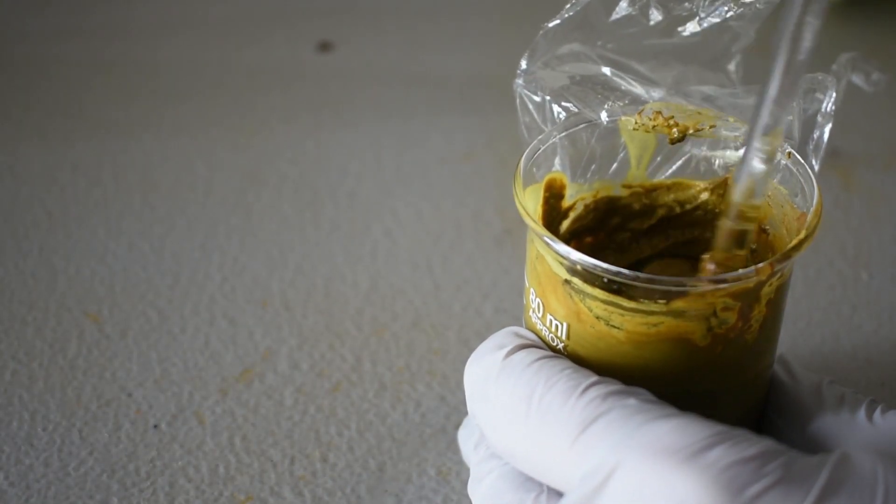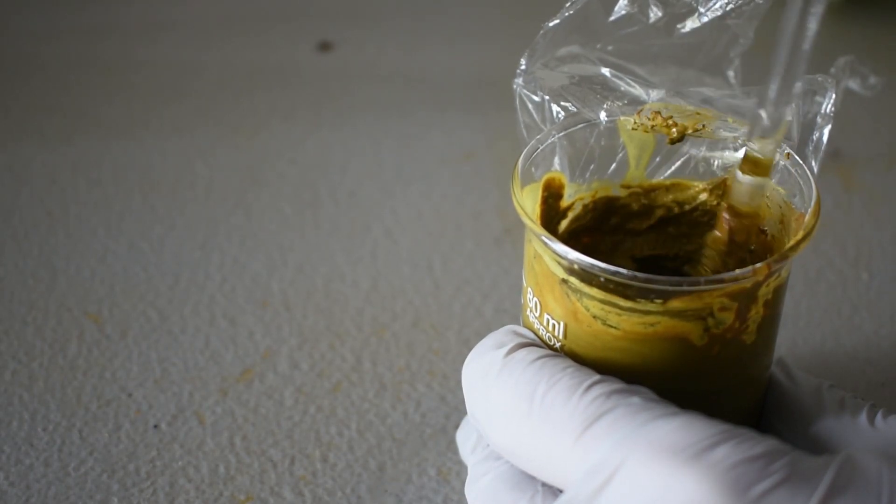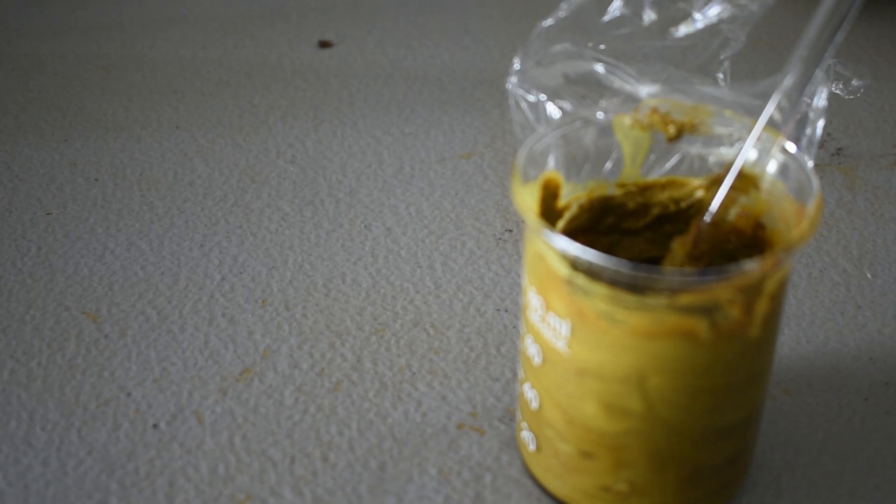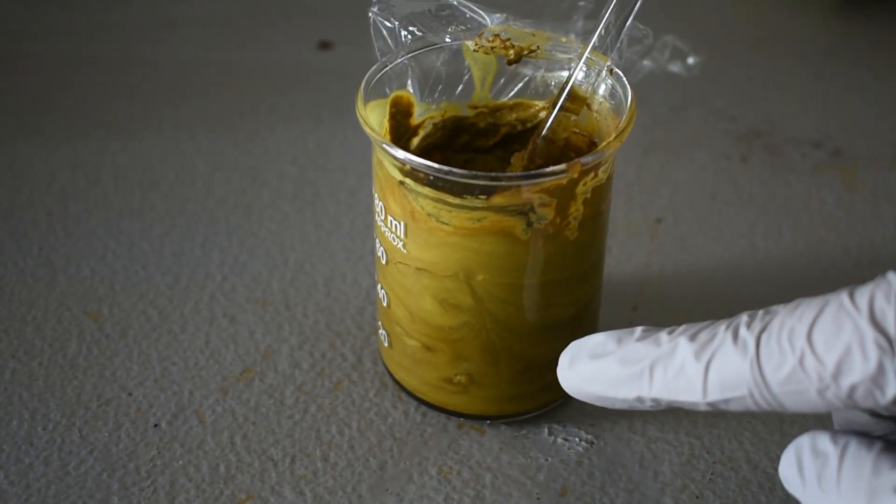Next, I'm going to attempt to kind of fix this issue by filtering and rinsing with probably combinations of pyridine and methanol. But it has made a nice swirl pattern on the side of the beaker.